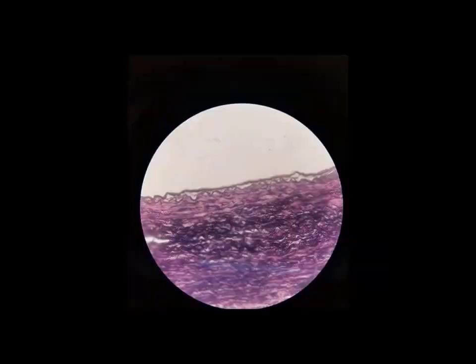And the last tissue that we will look at for this lab is elastic connective tissue. And elastic connective tissue we find several places throughout the body, but the best example is in the walls of your blood vessels. And when we look at this, we see all these really dark lines, and those dark lines are elastic fibers. And we can see that those elastic fibers are kind of wavy, kind of folded, and that's because this tissue is unstretched.